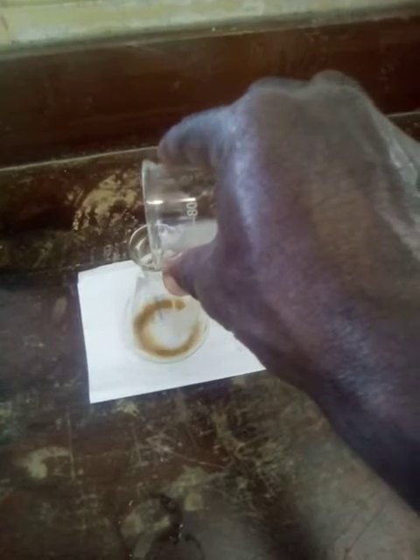Small amount. And then we're going to swirl. So what we get? We get a blue-black color change. Right? We get a blue-black color change. Alright? So this is one of the ways that we can use different reagents to identify if redox reactions actually occurred.